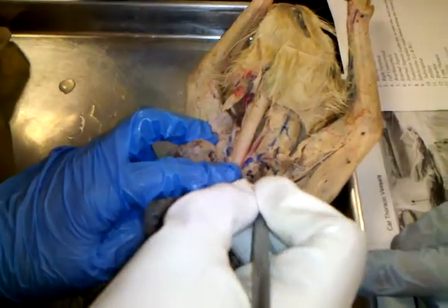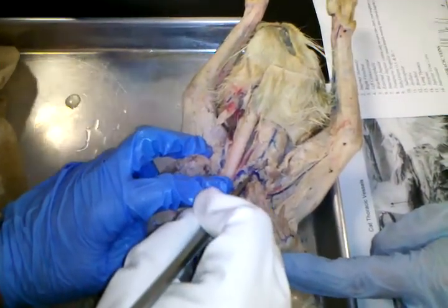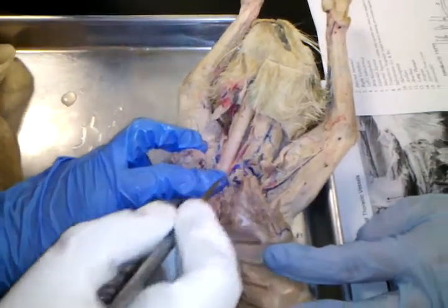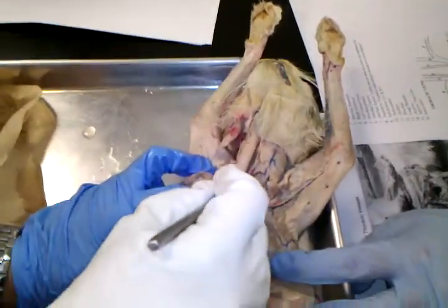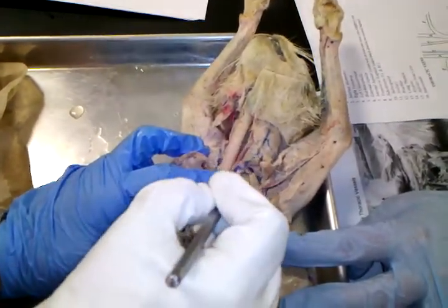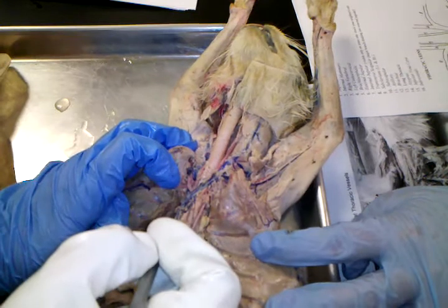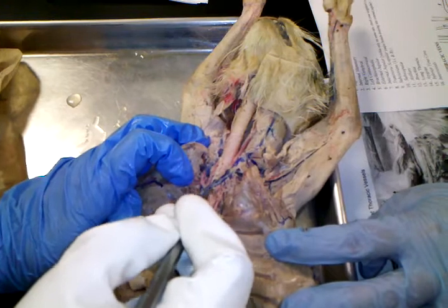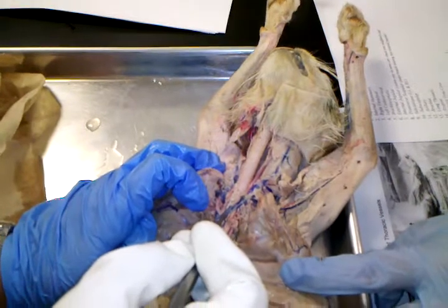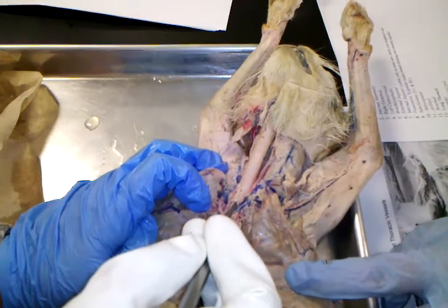There's one major branch that comes off of the jugular, and it's this one called the transverse scapula. If you'll pull your pictures, here's a picture. Let me show you where that is. That's number 8. You see that? 6 would be the jugular, common jugular, and then the only thing that comes off of it is this transverse scapula right there. Okay, and you see what I mean by it starts out as the vena cava, and as soon as it branches, it's listed 5-5. Do you see that? That 5-5 there is brachiocephalic. And then as soon as anything else starts branching, it changes names to number 9, which is the subclavian. Do you see that?